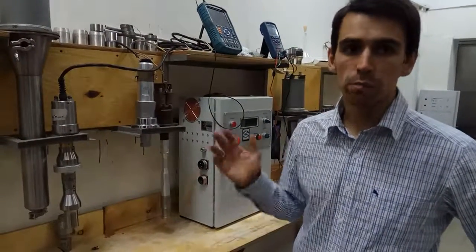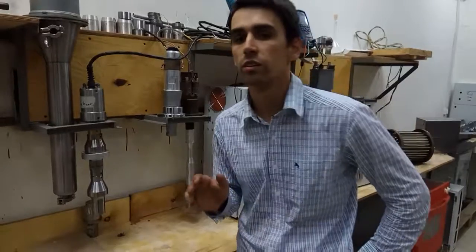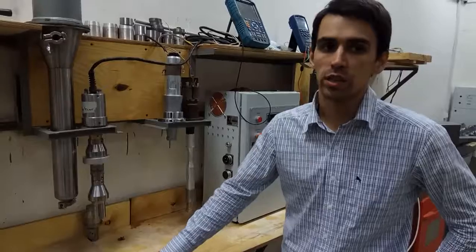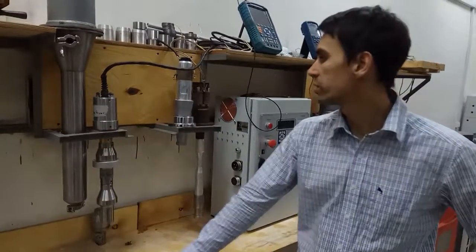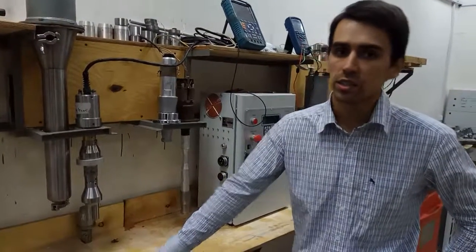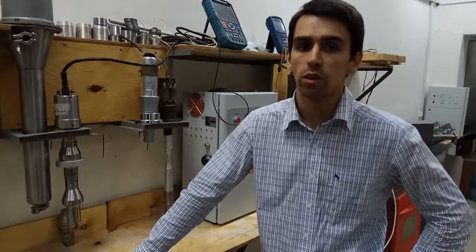This is our assembly site. Here I can show you separately the core, what's inside the ultrasonic reactor. I will briefly explain how it works and show you the examples that we have in our laboratory. At first glance, it may seem that this is just some piece of iron, but let's look at it in more detail. The core, the key technological element, is a set of equipment.